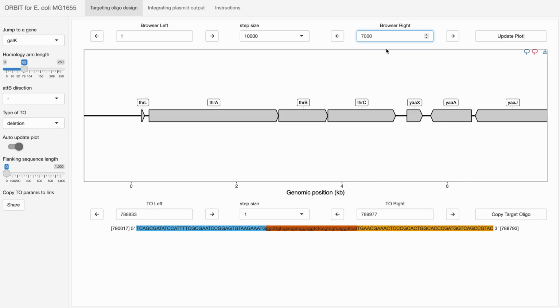The other thing to note about this kind of genome browser interface is that there may be times where we want to turn off the responsiveness of the app, which I call auto update. So we can turn auto update off and change multiple parameters and then click update plot. This may be useful if you're typing in specific genomic coordinates and you don't want the app to move or things like that.